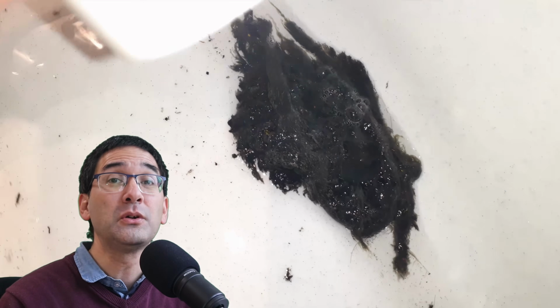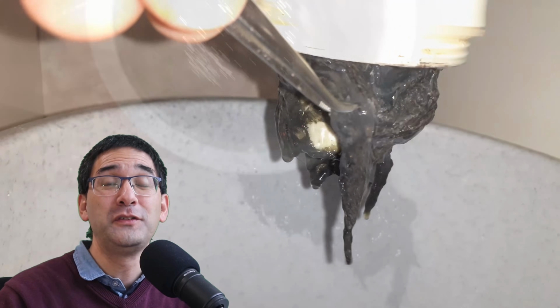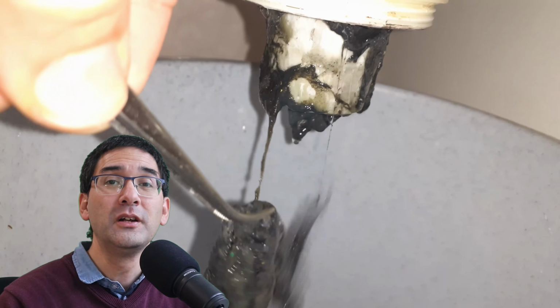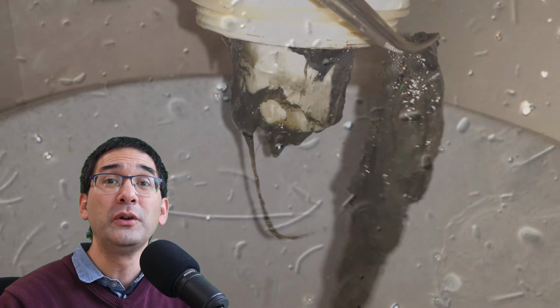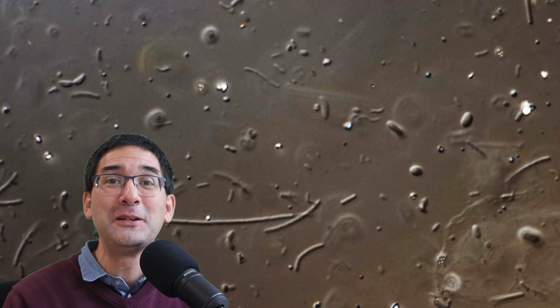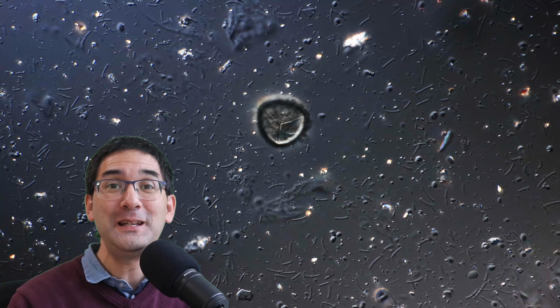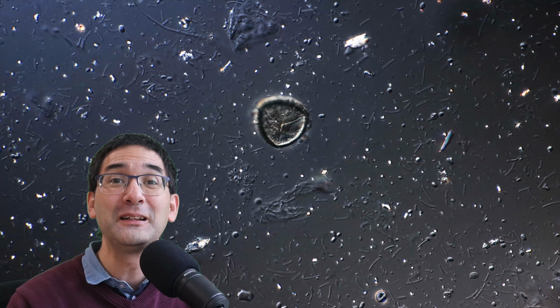And as a matter of fact, because there's always hot water running over it, this also kills many of the bacteria as well. So I can imagine that many of the bacteria that you find there are quite heat resistant. They're thermophilic right now. And now I'm going to show you in just a second, after I've shown you some of the other wiggly bacteria that I found there, this mystery object. I know what it is. It's a slightly triangular shape, kind of revealed a little bit what it is.